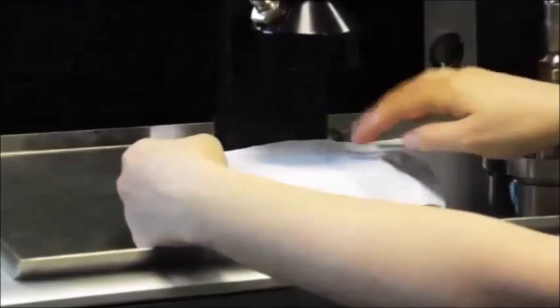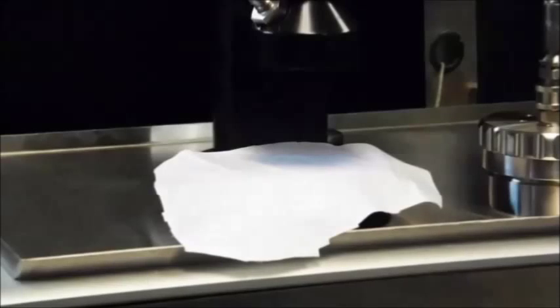The clamp chamber is perfect for samples that would be deformed or damaged somehow if you tried to fit them in the smaller screw top chamber.